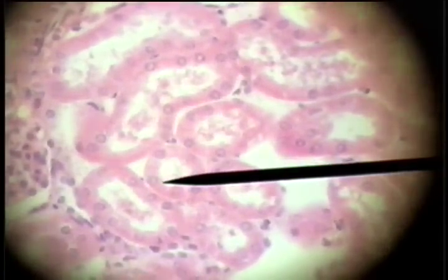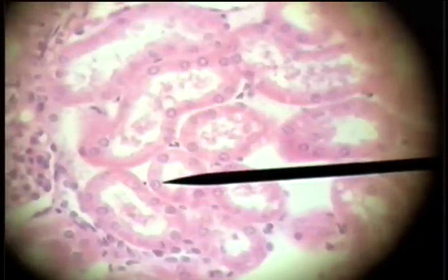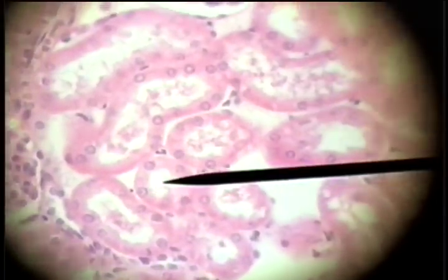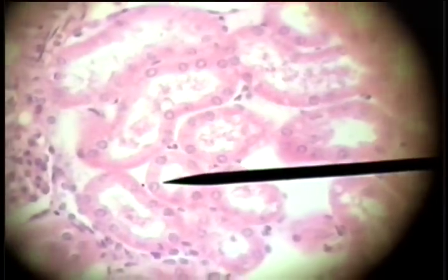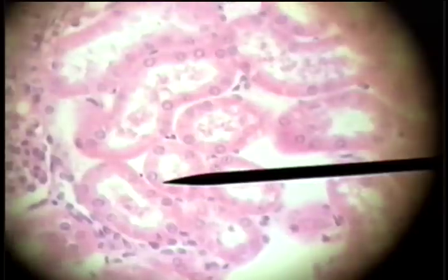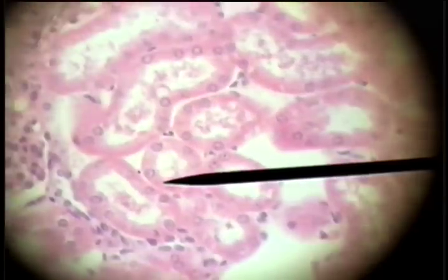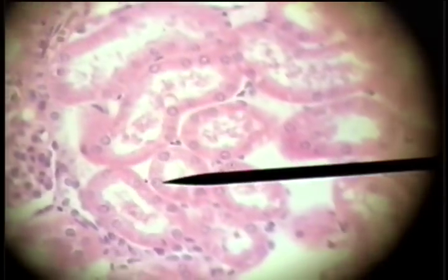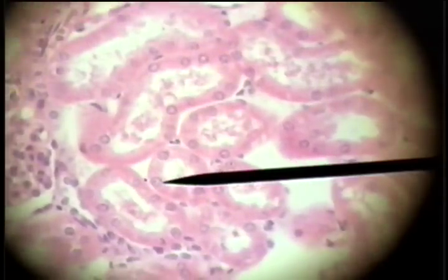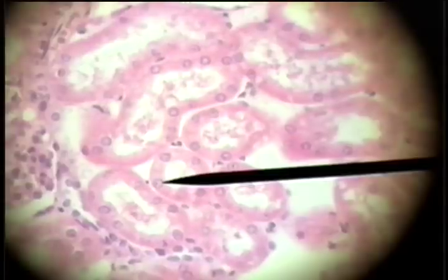Here's a cuboidal cell with its nucleus, and it's approximately as tall as it is wide, so this is a simple cuboidal epithelial cell found in the tubes of the kidney.